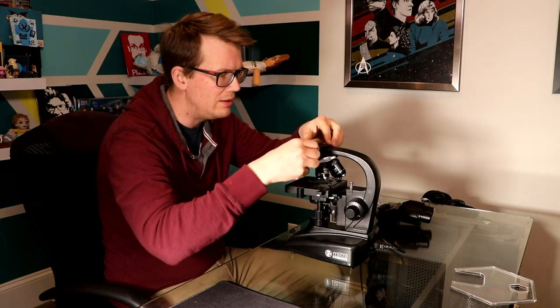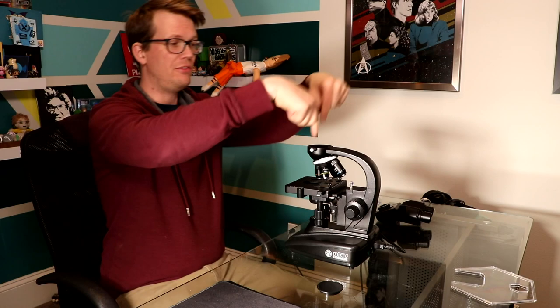We're just going to put the microscope together and get it operational and walk you through some of the knobs and twisty things that you're going to need to know about. You will take it out of the box and it will not be completely assembled. There will be several pieces that you can put on. Number one, you're going to take off this cap here. There's a little twisty thing that will let you twist and untwist the tightness on that cap.